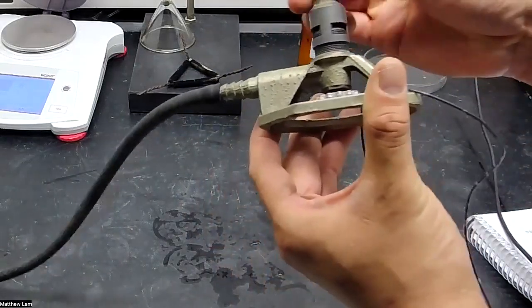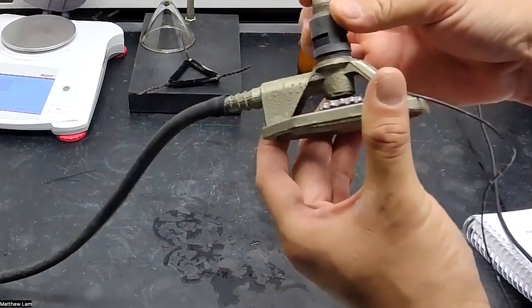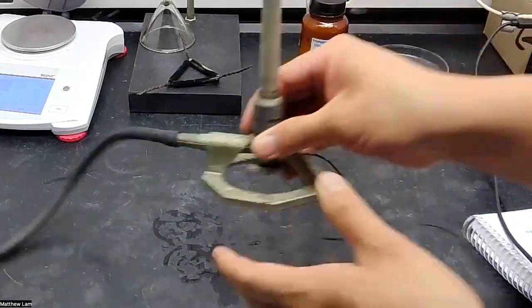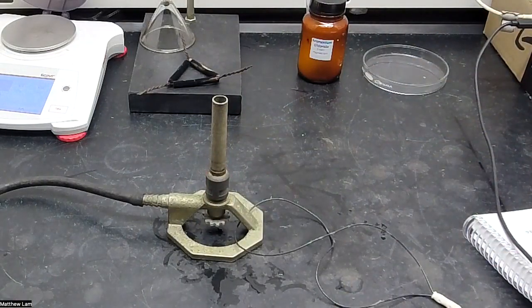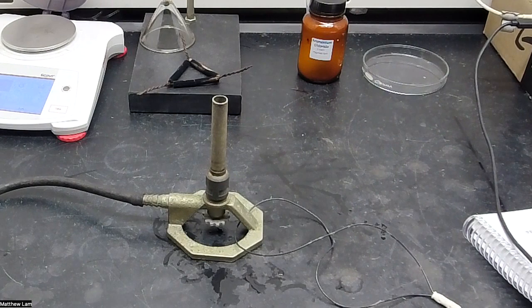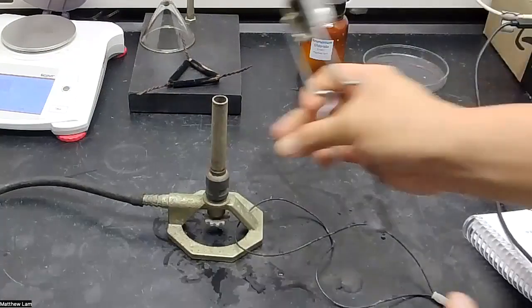Now, oxygen is food for fire, right? So the more oxygen the fire has, basically the hotter the fire gets. So we'll start it off with starting this guy up.